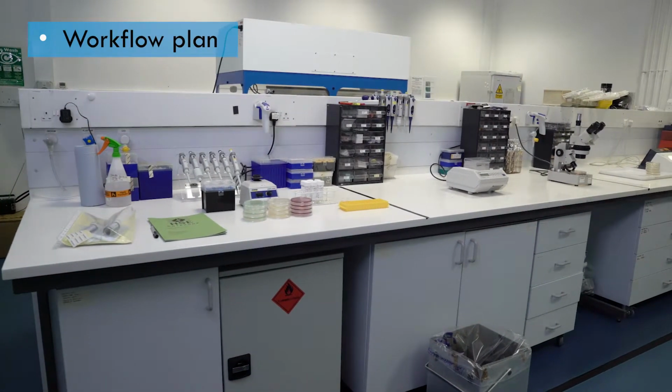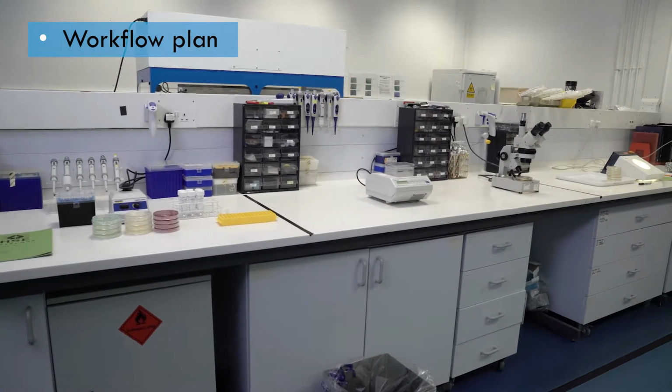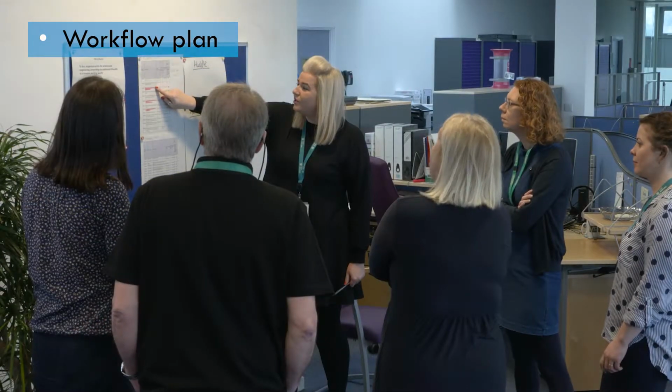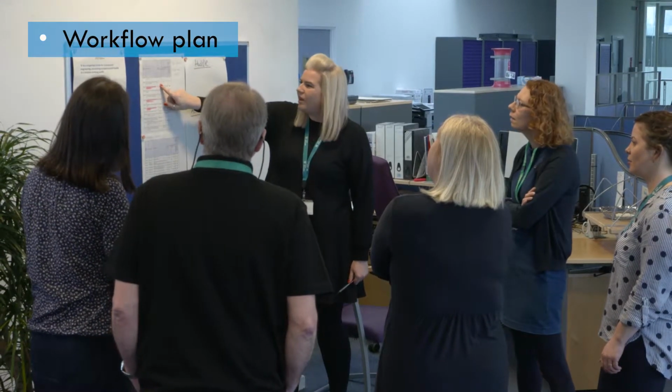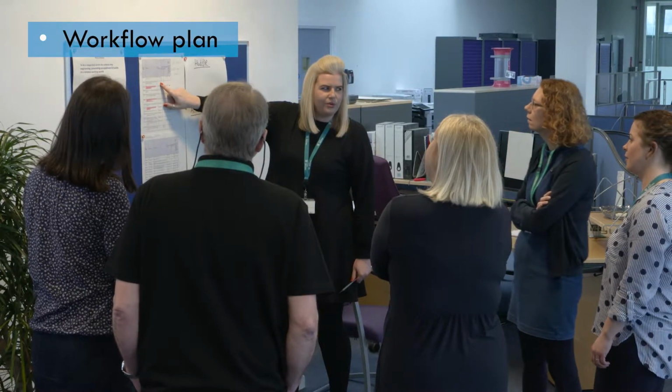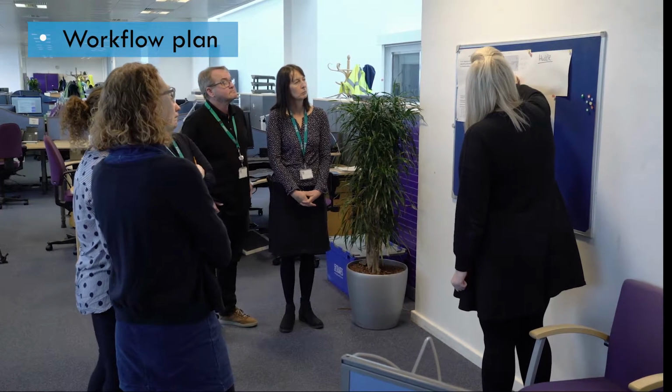Before any work begins in a laboratory facility, a workflow plan should be in place. The plan should be discussed with staff so that everyone understands their roles and responsibilities and how the work will be organized, from receiving samples through to reporting results.